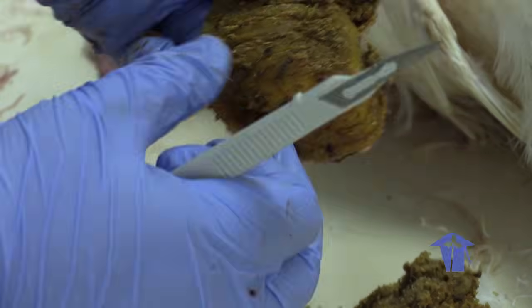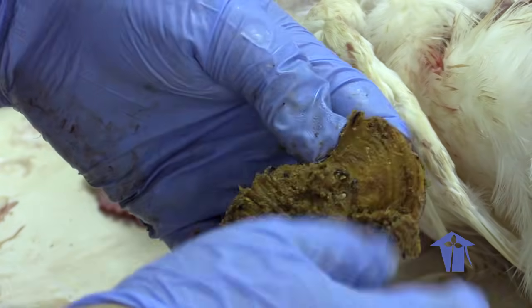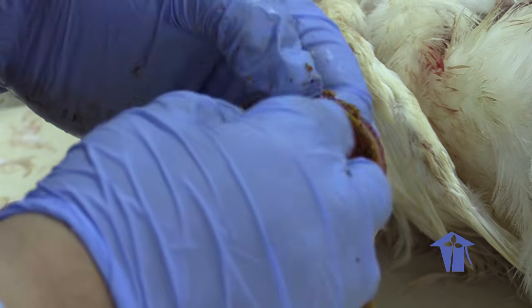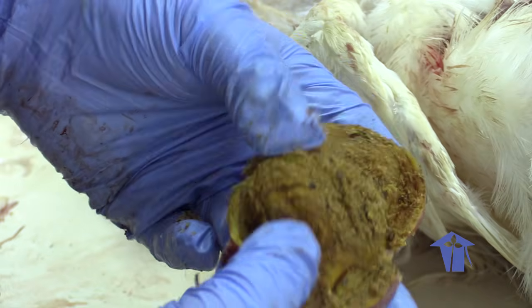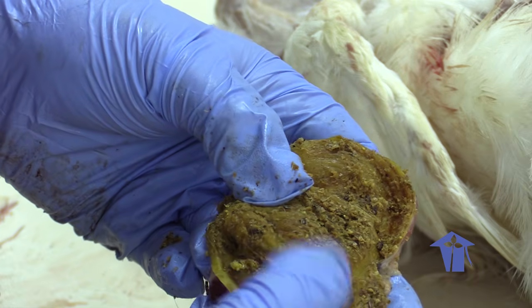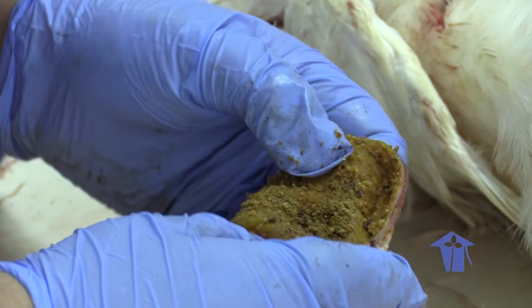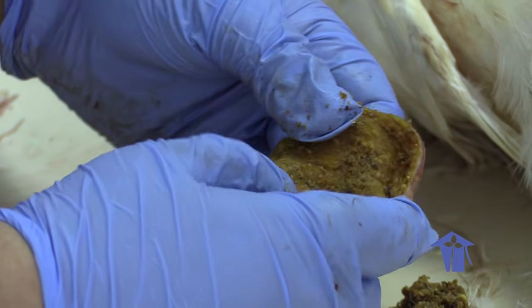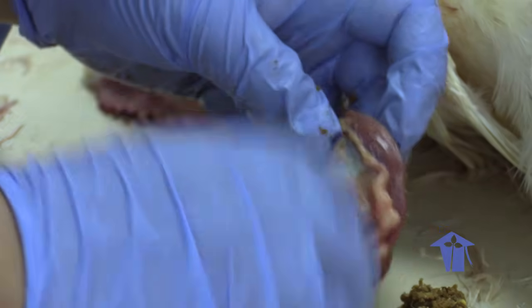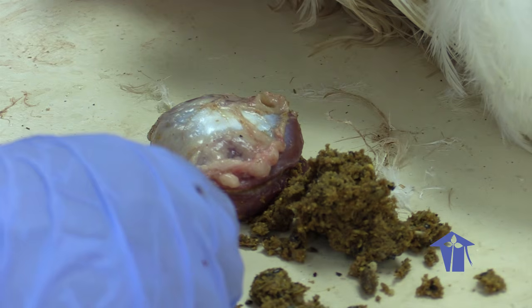Okay. So the inner wall of the gizzard is very fluted as well. Right? If you're preparing this for cooking, you have to basically peel that inner layer off. Right? So it's ridged, it's fluted, it's very rough. It's actually rougher and tougher than the actual skin of the chicken. If you've ever prepared gizzards for cooking, you know what I'm talking about. Right? So that's where the food is ground up to be passed on to the rest of the digestive system. So that's the digestive system of our chicken.